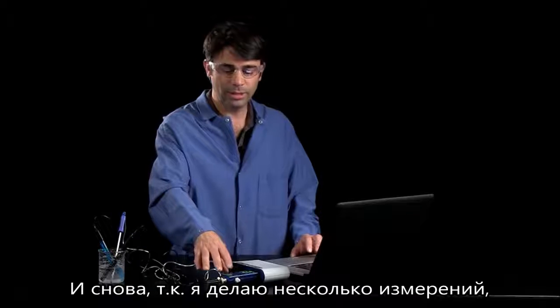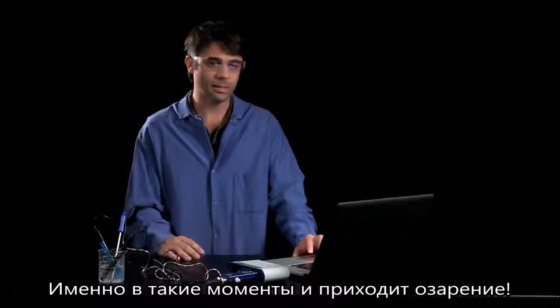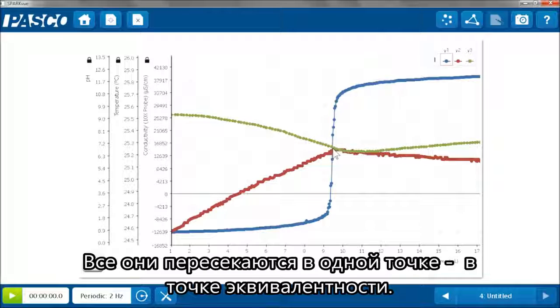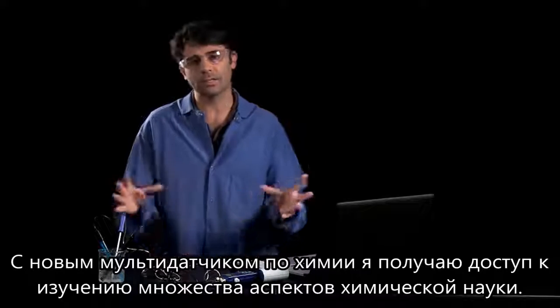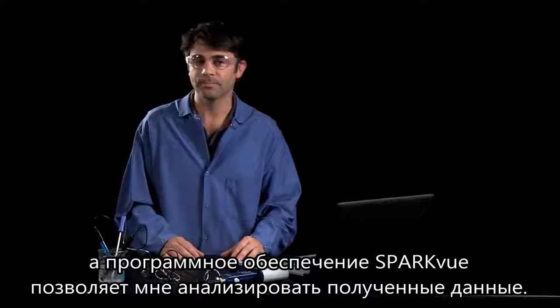And again, because of the multi-measure nature of this, I can look at all those things simultaneously. And this is really where the big ideas can come together. So here's my graph of pH, my Y1, temperature, my Y2, the red one, and conductivity, the Y3. I can see they all meet up at the same point where the equivalence point was reached, and that's where the inflection points for those graphs were. So with this new Advanced Chemistry Sensor, I can have access to lots of chemistry concepts, both individually and simultaneously, because of the measurements I can make, the software I can use, and the analysis that I can do.